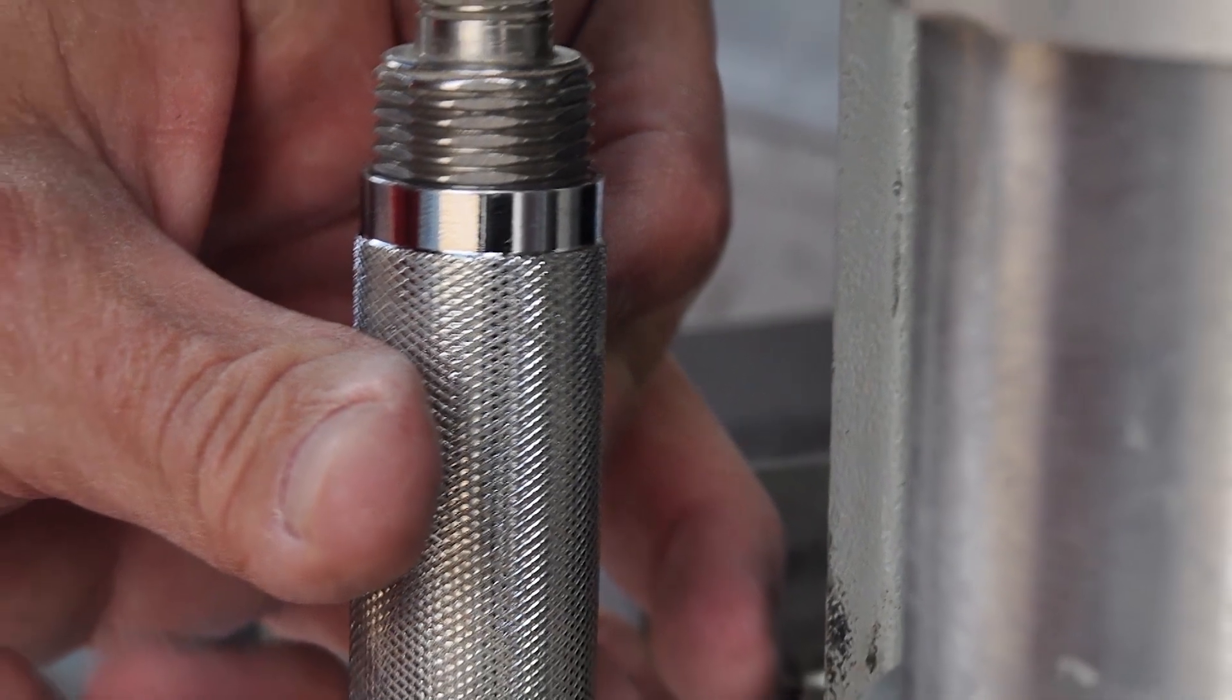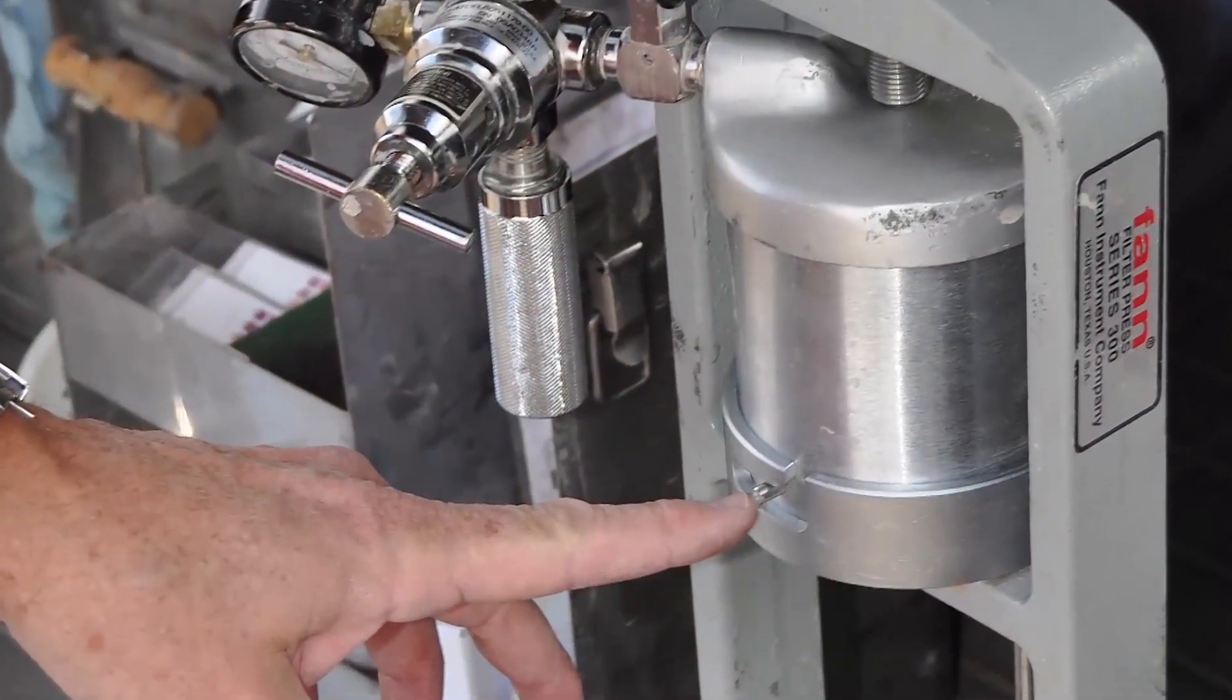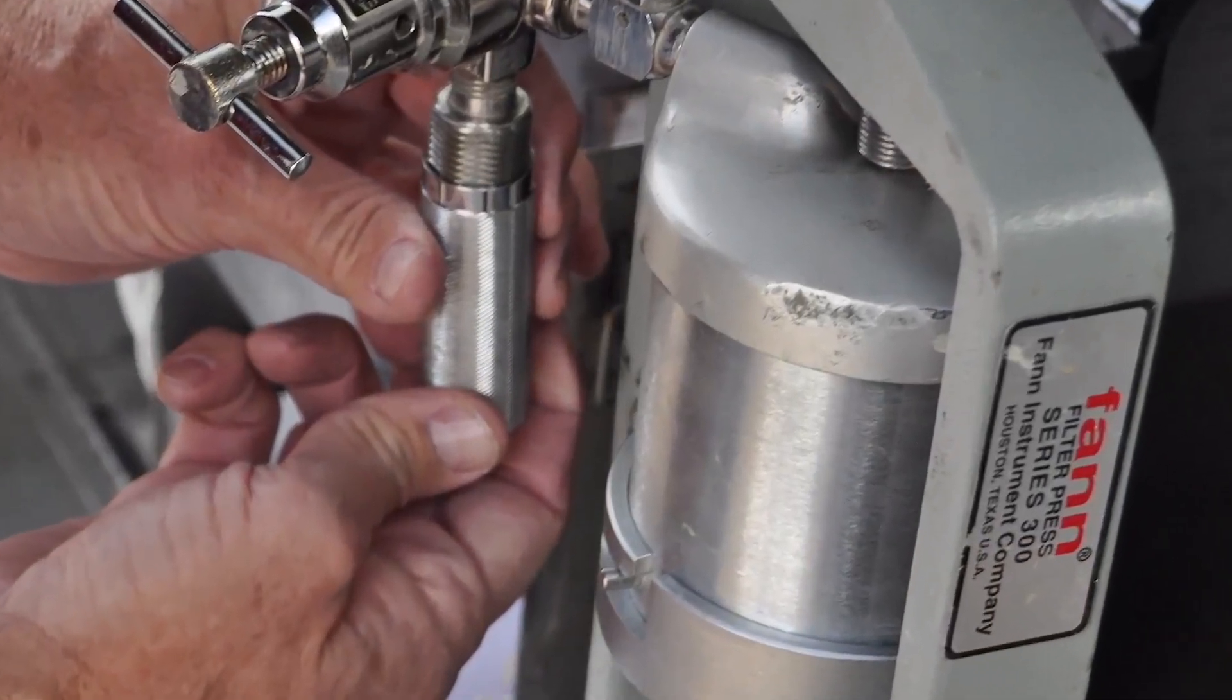In reality, the filtrate is the water or liquid phase of the drilling fluid that is available to react with the formation and the drilled cuttings.